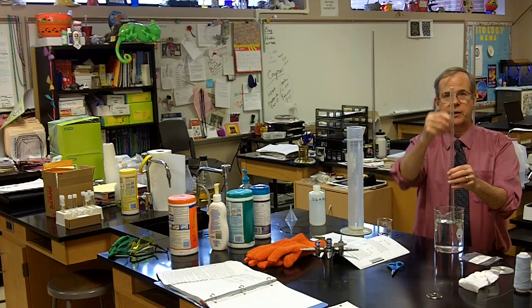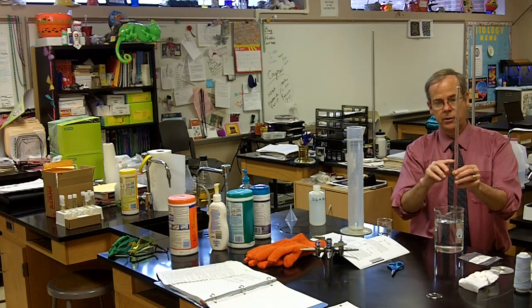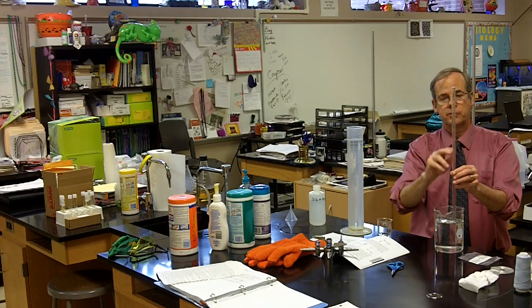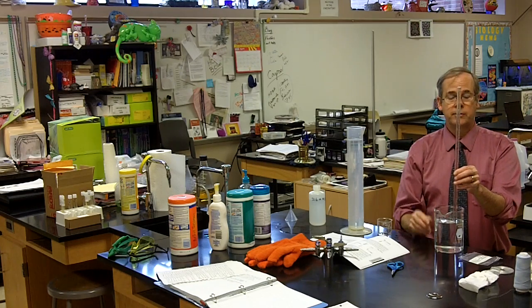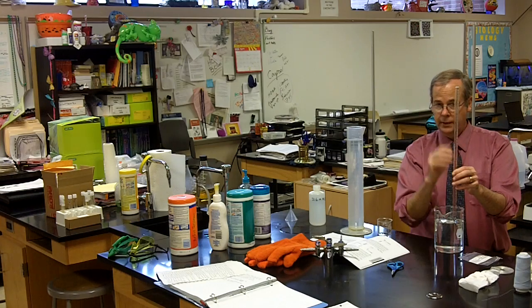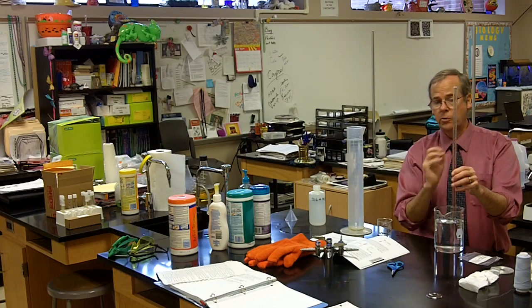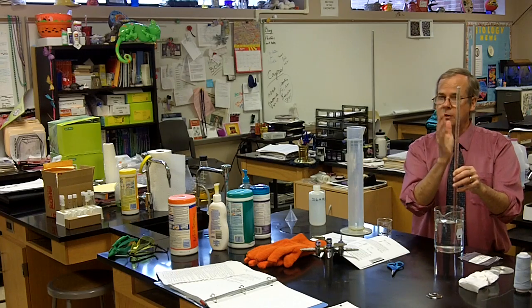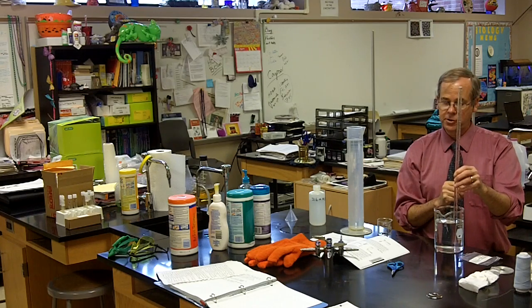I have successfully collected above water this amount of hydrogen gas. But of course, remember, there's also water vapor in here. Now, if I'm going to do some stoichiometry and calculate how much magnesium we reacted, I'm going to need to know how much hydrogen gas is in this tube.